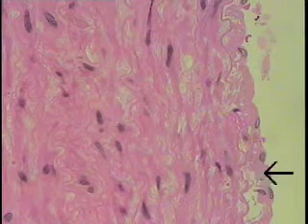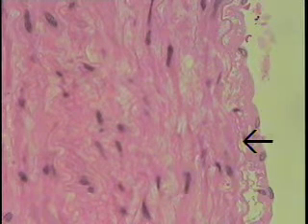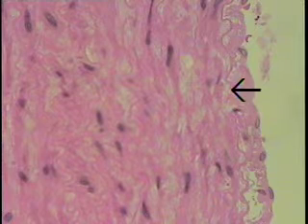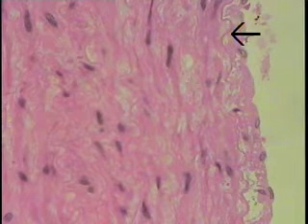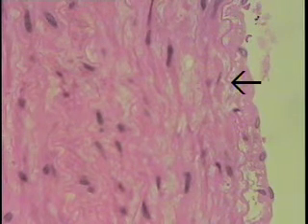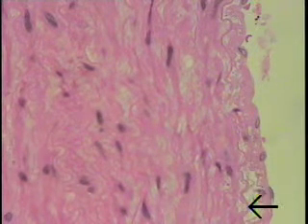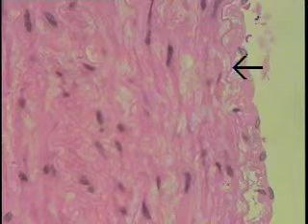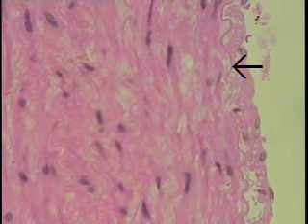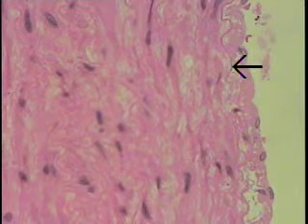Immediately underlying the endothelium is a delicate connective tissue that extends from about this point, where the arrow is indicating. This is referred to as the subendothelial connective tissue. And immediately beneath it lies a large elastic lamina, the scalloped elastic band we're seeing here in section and being traced by the arrow. This is the internal elastic lamina. So those three elements, the endothelial lining, the subendothelial connective tissue, and the internal elastic lamina, constitute the tunica intima.